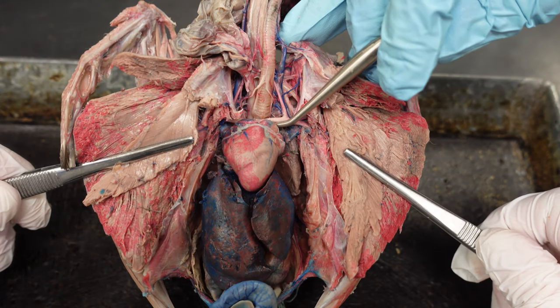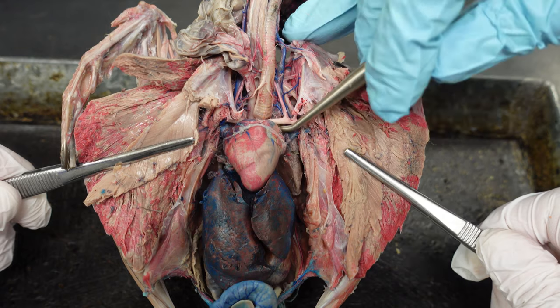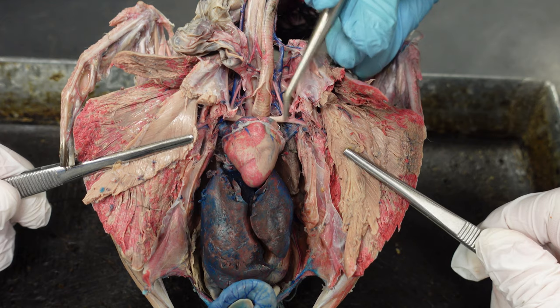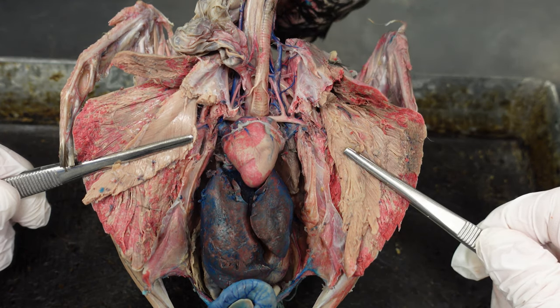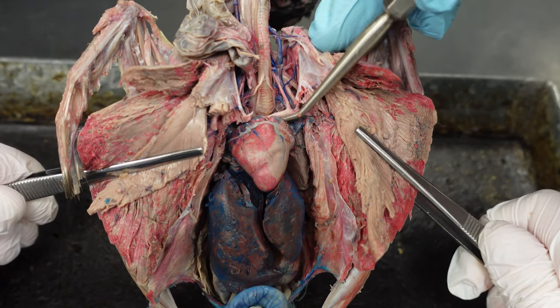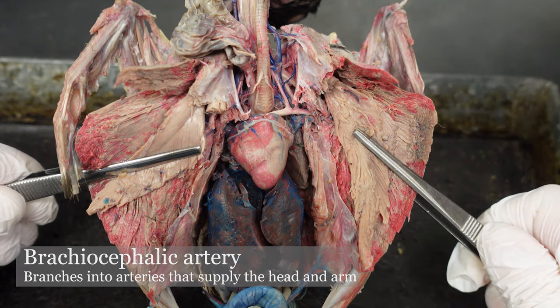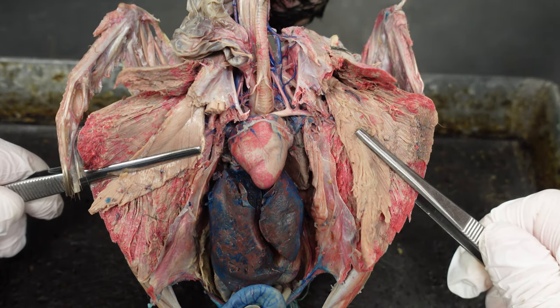We're going to go on the pigeon's left side just because that is closest to me. Coming off of that aortic trunk, we have two branches that head straight out laterally, at least they do right now because of stretching. This is the brachiocephalic artery. Coming off of the brachiocephalic artery, we have arteries going toward the head and arteries going toward the arm.